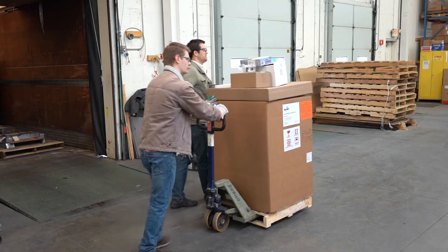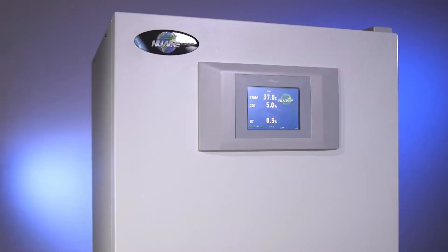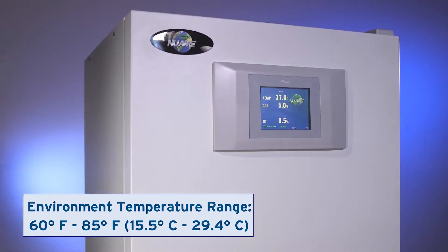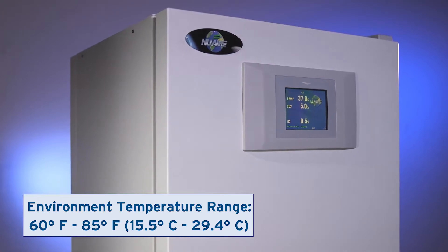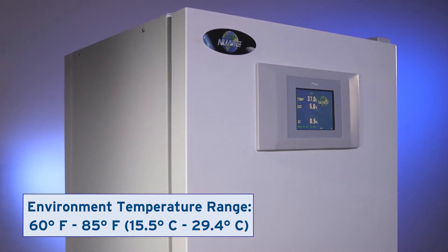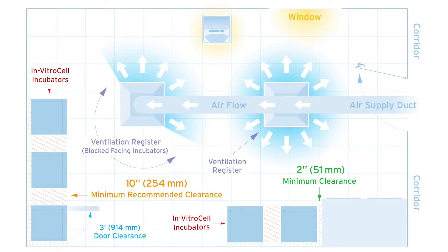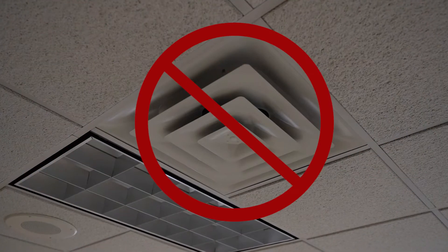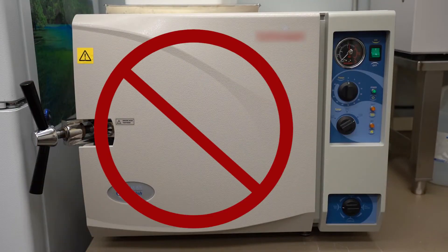After passing inspection, two people should move the incubator to the laboratory. Install in a stable temperature between 16 and 29 degrees Celsius. Place the unit where it can control its own heat without interference. Choose a location in the room with no hot or cold air currents.